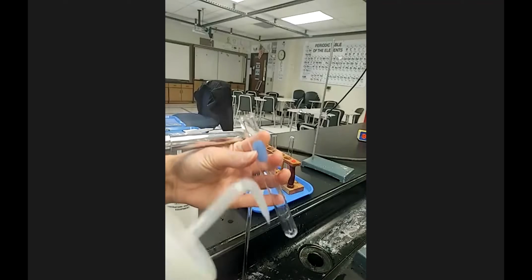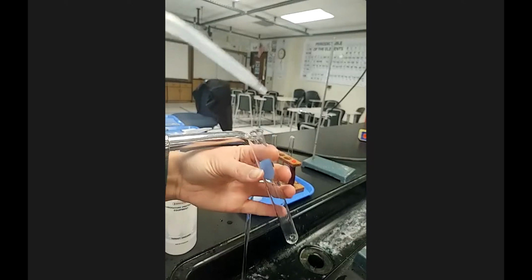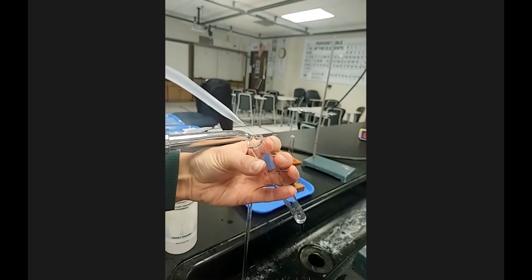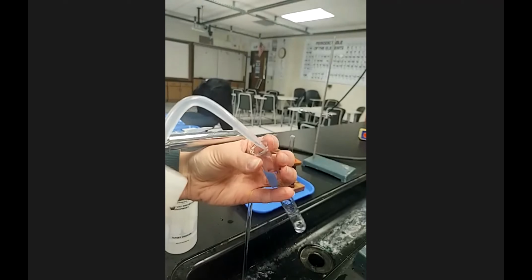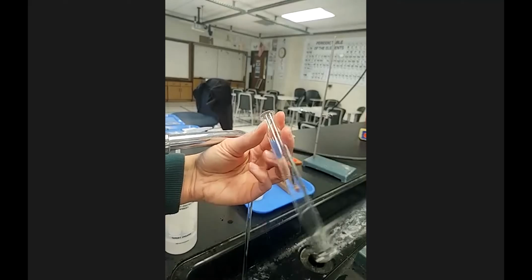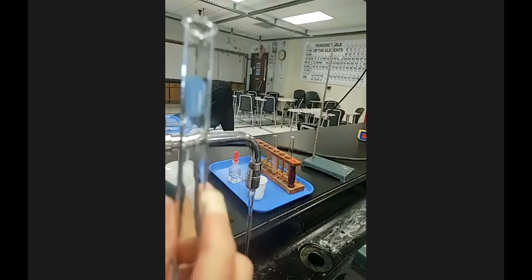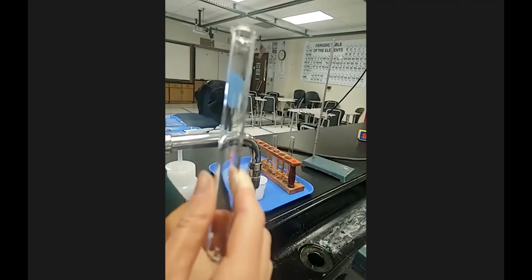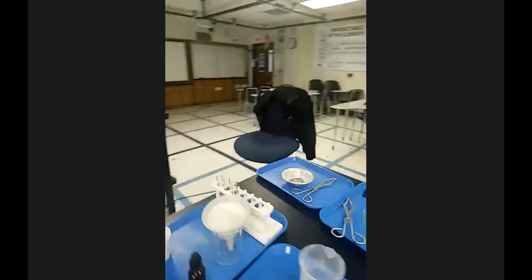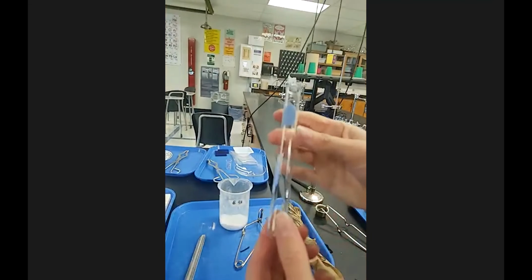And rinsing with distilled water is not like filling this whole test tube with distilled water. So here I have the distilled water bottle. I'm literally just squirting a little bit on the sides of the test tube, giving it a little swirl and then dumping it. That's rinsing glassware with distilled water. It's just covering it a little bit, rinsing out any remaining ions from the tap, because we know that there are some ions in tap, but there's not that many. Remember, it wasn't that conductive, so you don't need to go ham on rinsing with distilled when you clean it with tap.